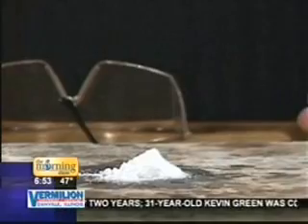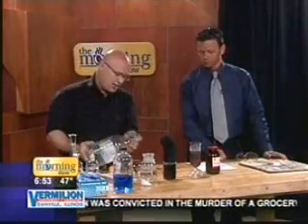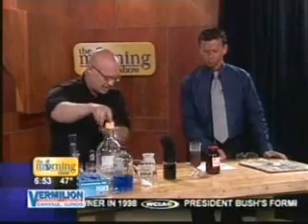The potassium chlorate and the sugar, it's quite spectacular. Unfortunately, it is thermodynamically favorable, but it's just sitting here right now. So we're going to add a little sulfuric acid to get the reaction going. So for this one, we want to put our glasses on. Need some specs. I got an apron just in case we need that. I think we'll be all right.